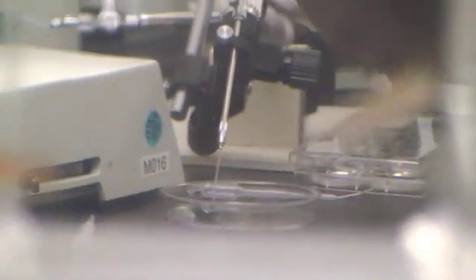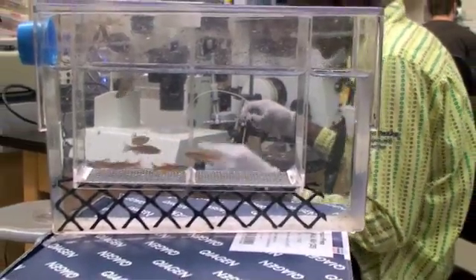After incubating the injected embryos to the appropriate developmental stage, the protective chorion may be surgically removed using a fine watchmaker's forceps to facilitate visualization under a fluorescent microscope. Care must be taken, however, to not damage the fragile embryo at this stage.